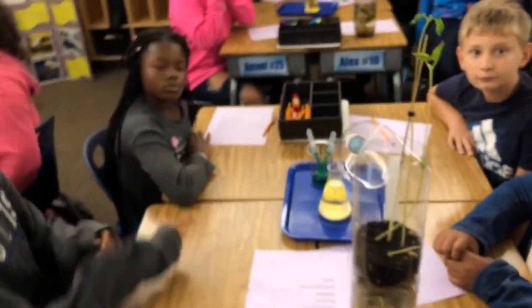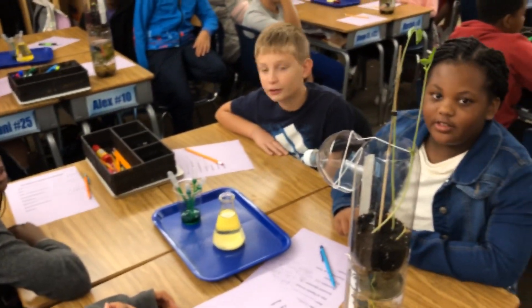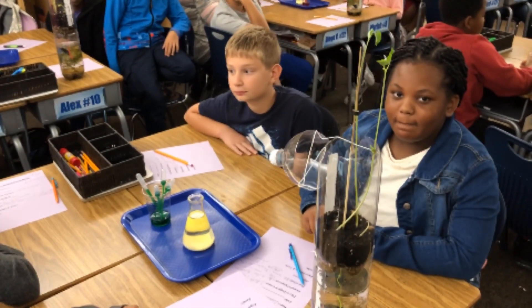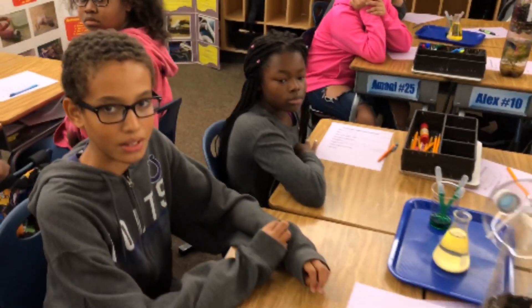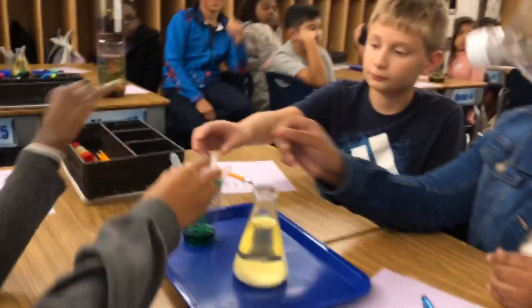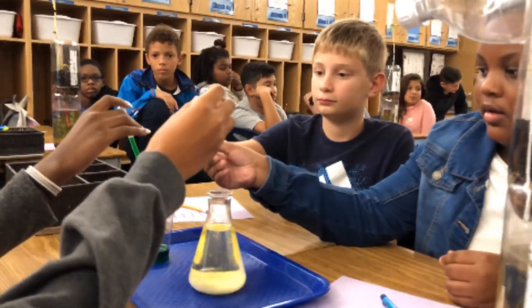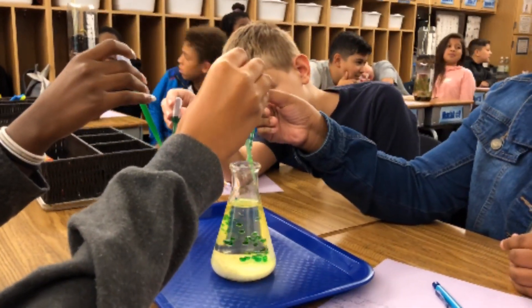Now I'm at table three. Table three — is this lab exothermic or endothermic? It's endothermic. So this isn't going to release heat, is it? No. And heat isn't what makes the bubbles rise, is it? No. Okay, grab your dropper and let's add some of your catalyst — some acetic acid — and see what happens.